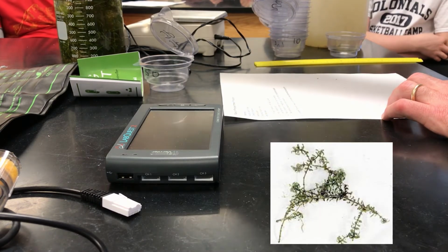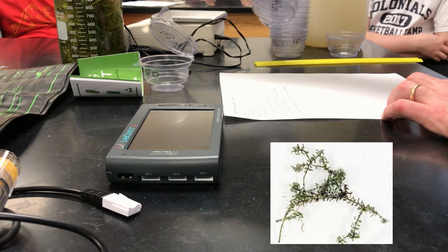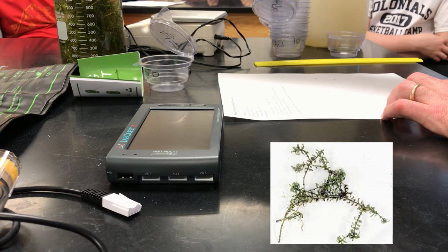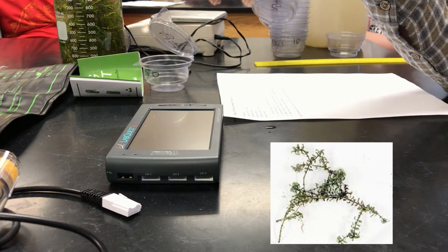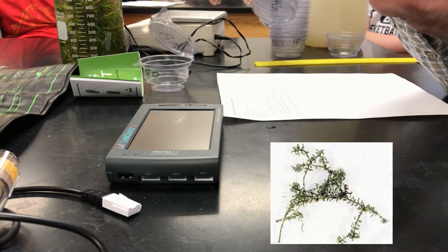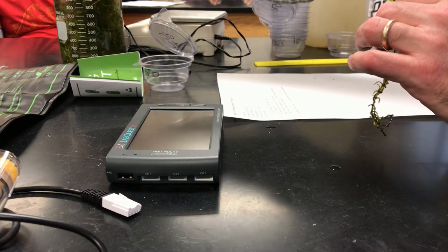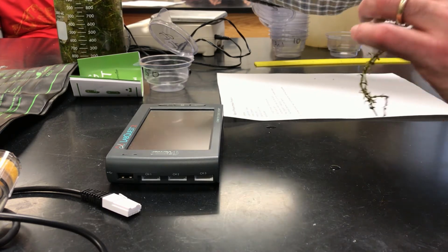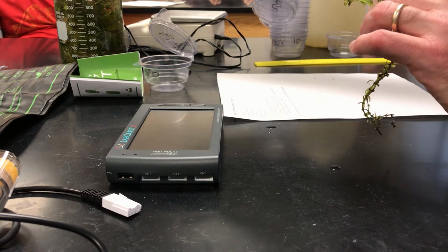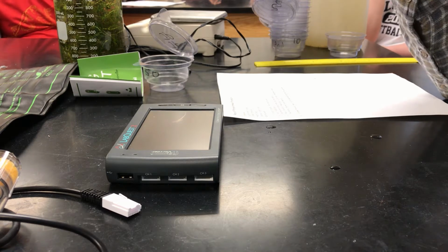All right? And what we're going to use as our model organism in the system is Elodea. This is the same plant that we used for our photosynthesis model CER that we did at the beginning of the year. And so what you'll end up seeing is that we'll have plants here. Now, a couple of things about these plants that we'll notice is that they have these offshoots and sides, and they're also not all the same. Some of them are just little tiny tips, and some of them are super long. So you're going to need to come up with a way of standardizing the plants that you're dealing with.